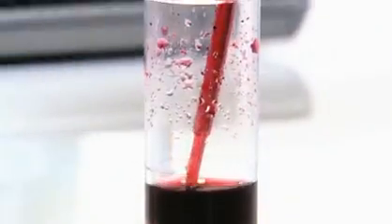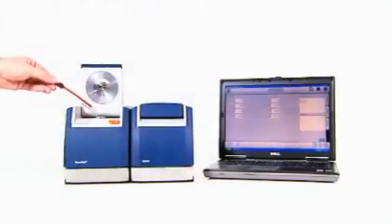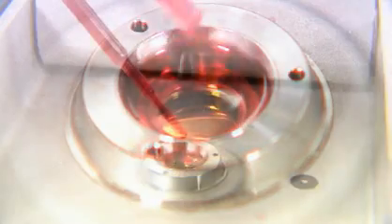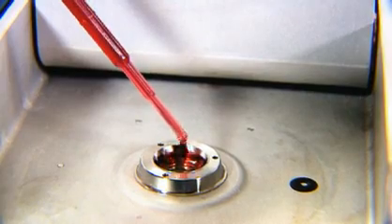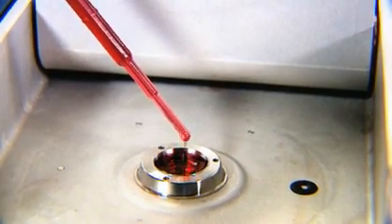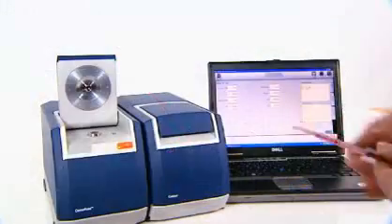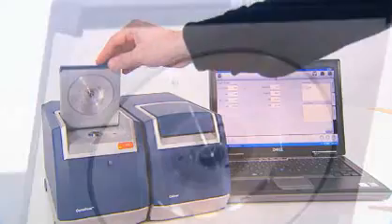Then, take a little more of the same sample and put a drop into the small sample cup on the standard module. Lower the lid immediately in a smooth continuous motion.